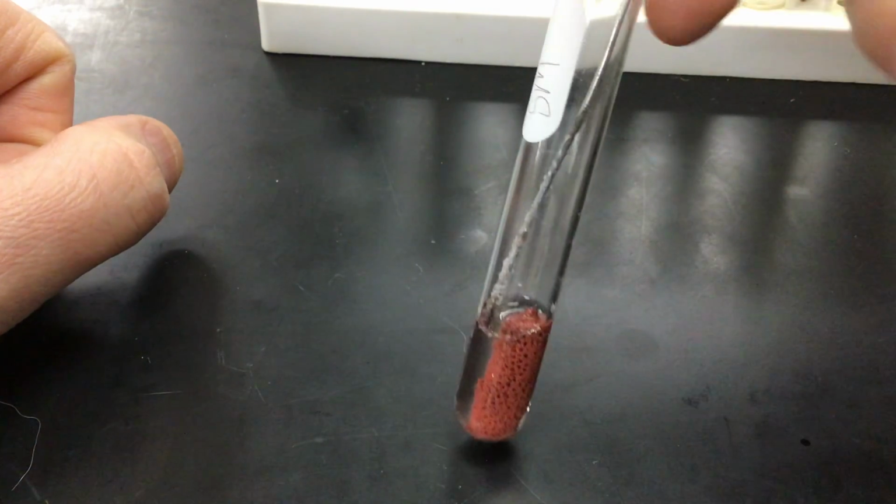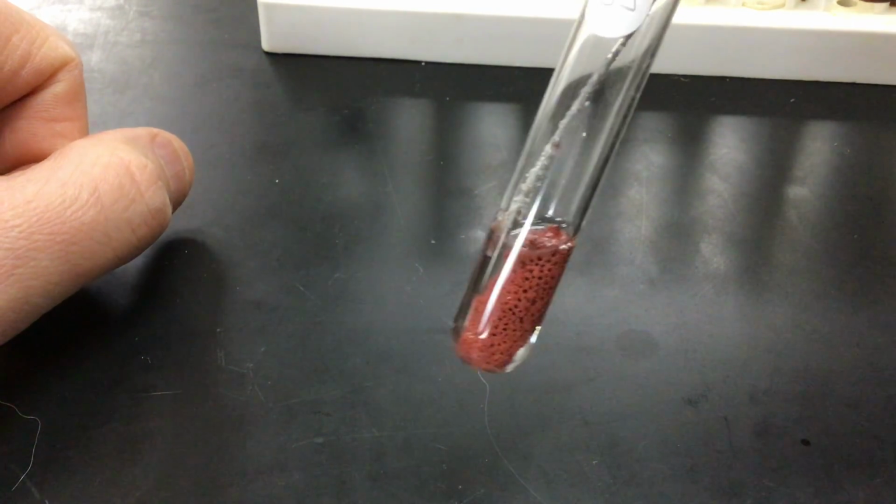So what I'm going to do instead is show you what happens when you let it sit. And this one has been sitting for over a day. And so my students who are showing up to class will now, next time we meet in a cycle, be able to take the final appearance observation of the compound.